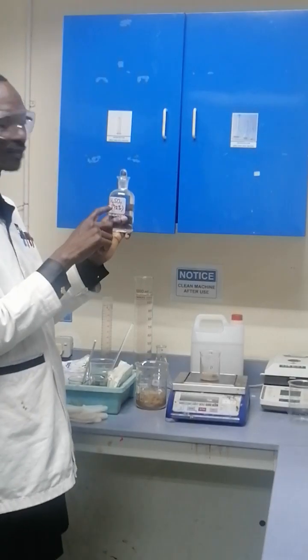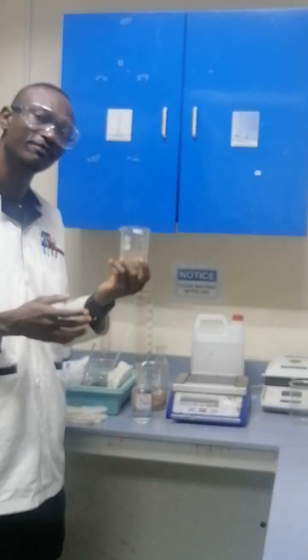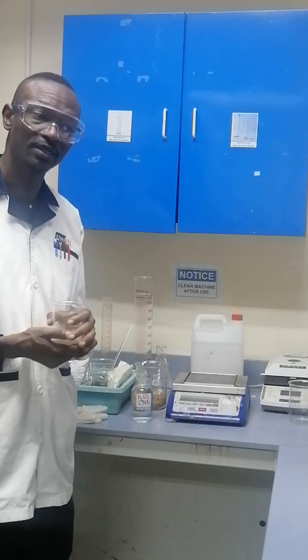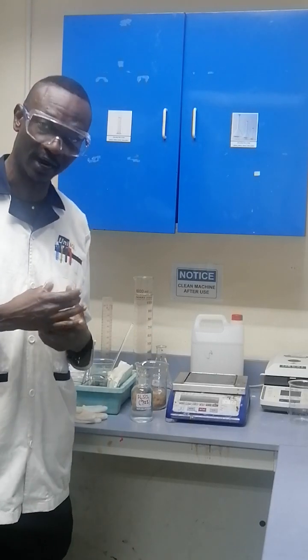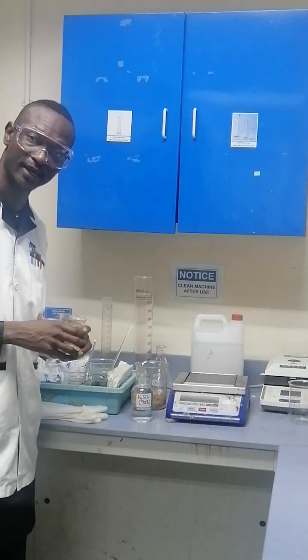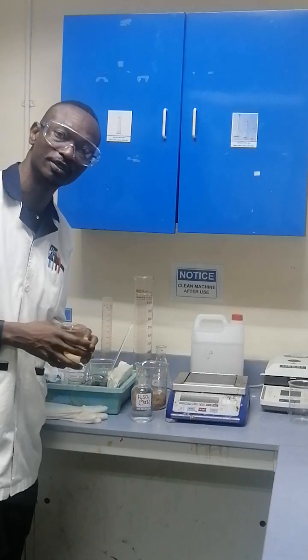We have our 72% sulfuric acid. The quantity of biomass in this case is 5 grams. The protocol requires that every 1 gram of plant biomass should be hydrolyzed with 15 ml of 72% sulfuric acid. So for 5 grams, we will need 75 ml of 72% sulfuric acid. We have about 4 replicates here, so in each beaker we are going to measure 75 ml of 72% sulfuric acid.